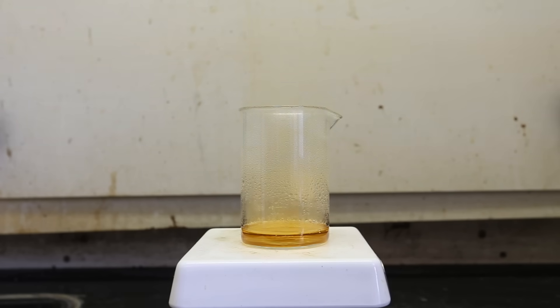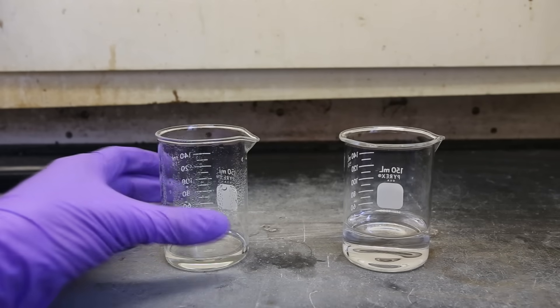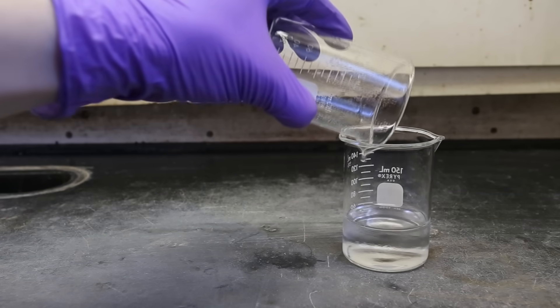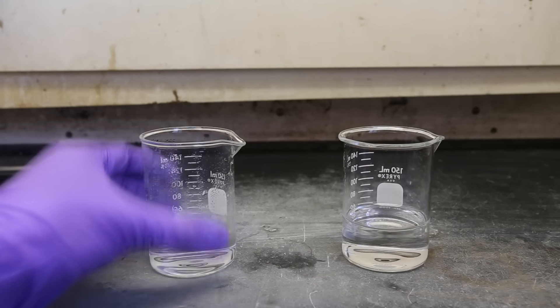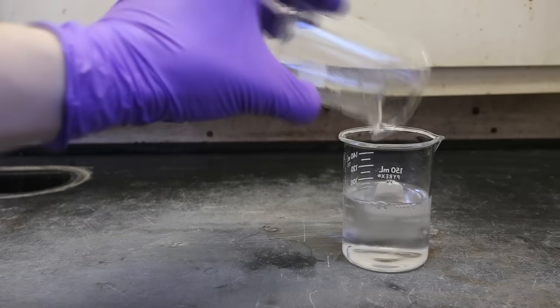At this point, remove the solution from heat and let it cool to room temperature. The solution should clear up, and once at room temperature it should appear crystal clear. This is what the solution looks like after about 10 or 15 minutes. Next, transfer the nitric acid mercury(II) nitrate solution to about 40 to 45 milliliters of water, then rinse your solution flask with about 40 milliliters of water — optionally rinsing twice with 20 milliliters each.